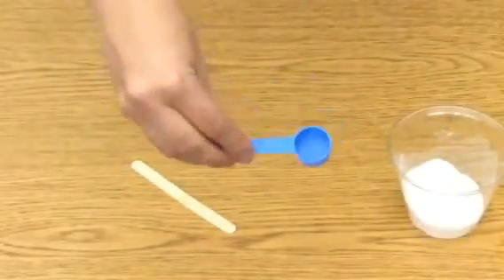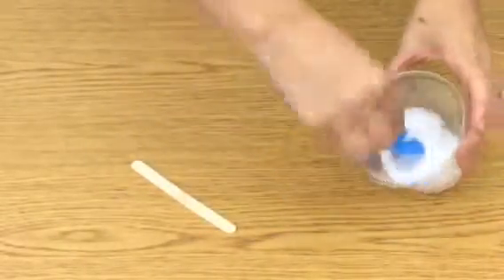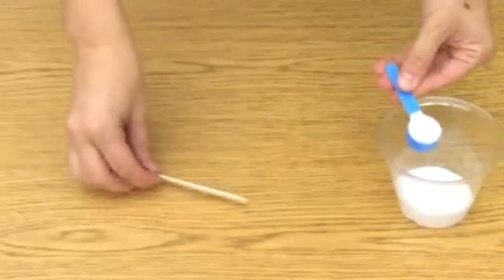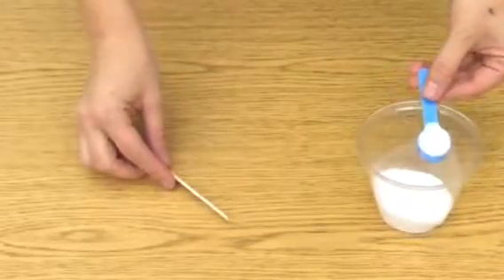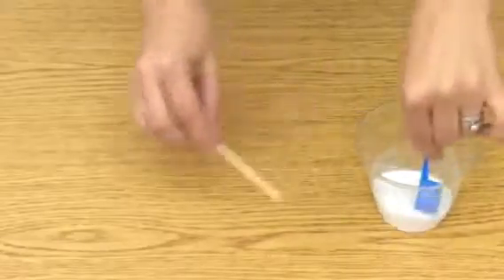First tool I'm going to show you how to use is the measuring cup. This is a very miniature one. In order to get 1 scoop, this is salt that I'm using, I'm putting it through, and I have a little bit of extra on top. In order to get rid of the extra, you're not going to use your hands because you don't want to be putting your hands in any chemical or material, especially if you're not sure what it is. So I'm going to use a popsicle stick to push it off now.